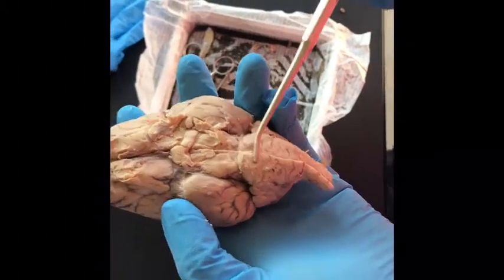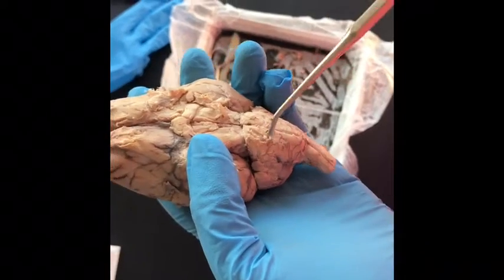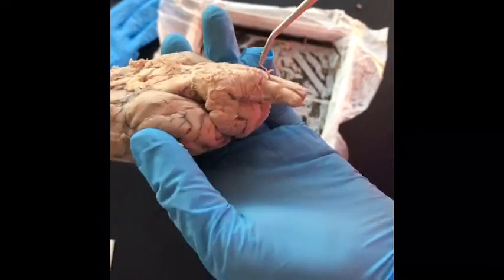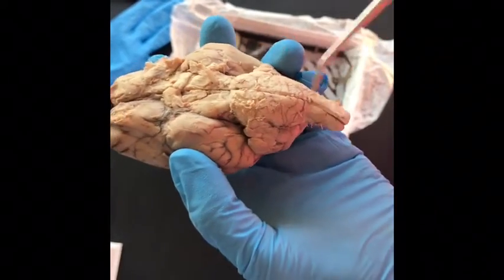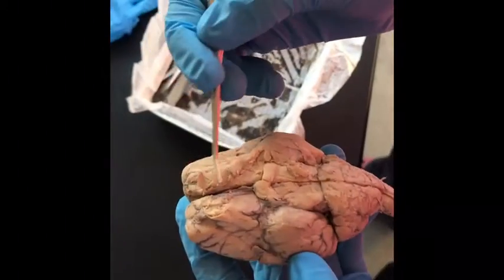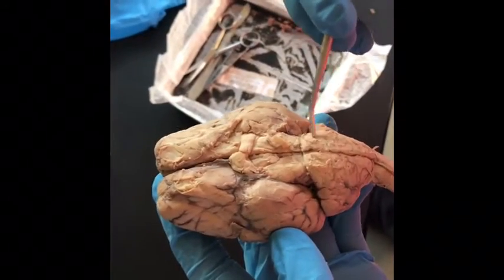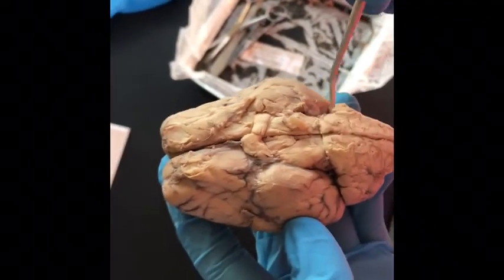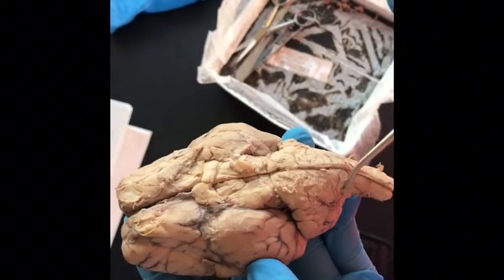The trochlear nerve is a motor nerve that activates the muscles. The abducens nerve controls the movement of the lateral rectus muscle in humans, responsible for the outward gaze. The pineal body produces melatonin. The superior colliculus is the integrating center for eye movements. The inferior colliculus is an auditory pathway and receives input.